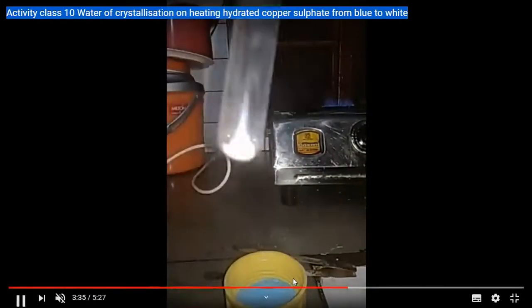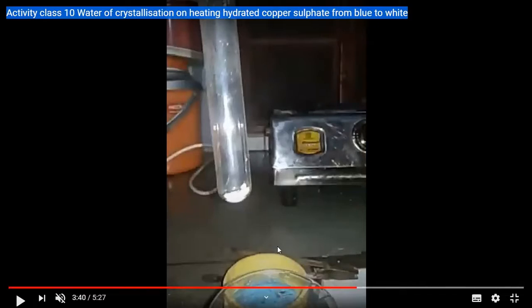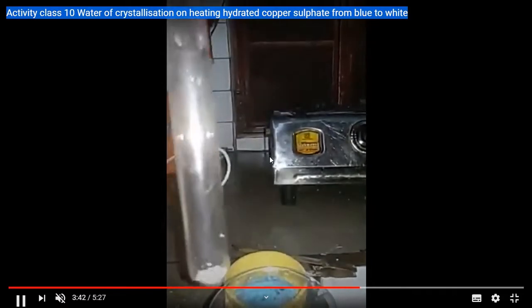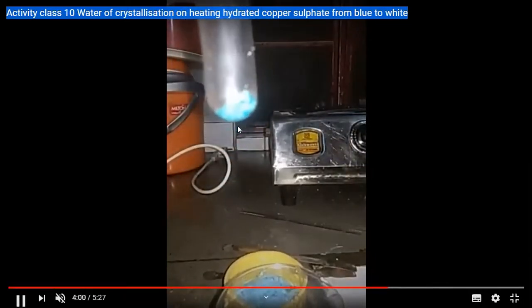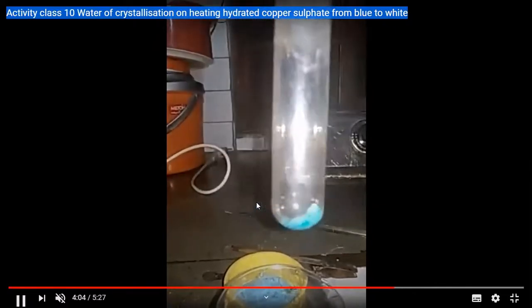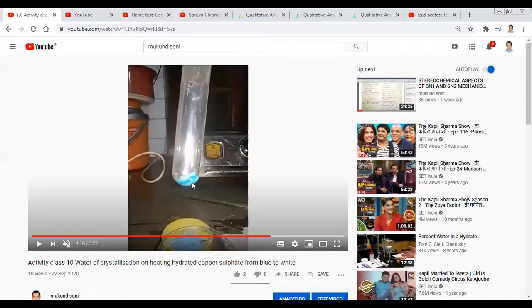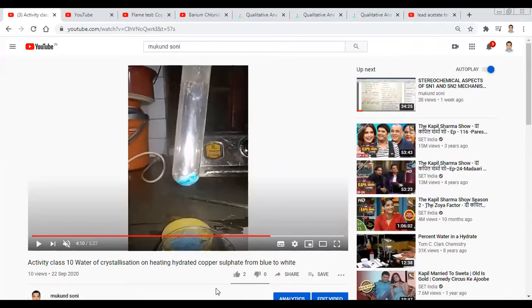So when we heat the given salt, we can observe that the blue colour vanishes and the salt turns white in colour. This white colour salt also produces water droplets collected at the mouth of the test tube. Now we are going to add water drop by drop to the white colour salt. You can see the first drop has entered and the white colour salt turns into blue colour by the addition of water droplets.